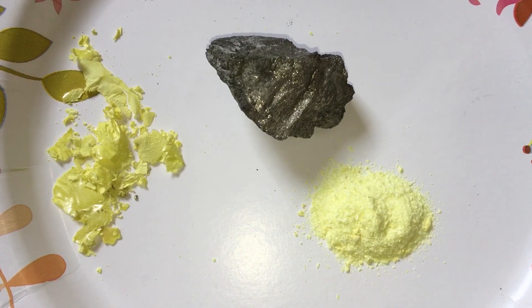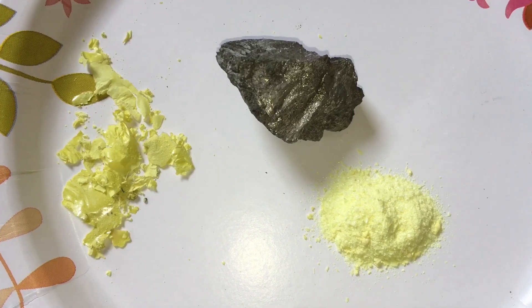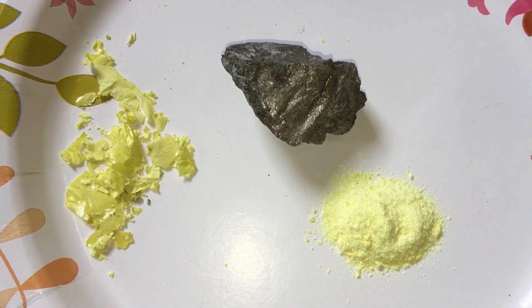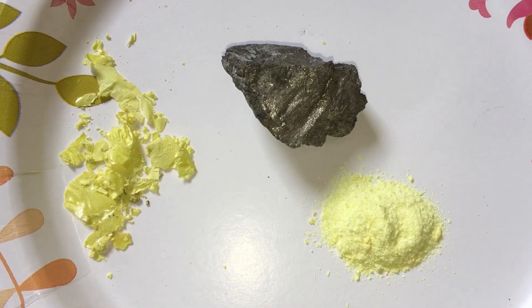It's been a few days and I used a glass jar the last time I tried this. It was about exactly the same as using that ceramic bottle, except whenever I went to clean it out, it was a lot easier to get it out in big pieces and it wasn't so dirty looking.